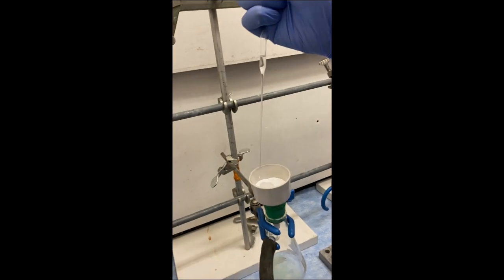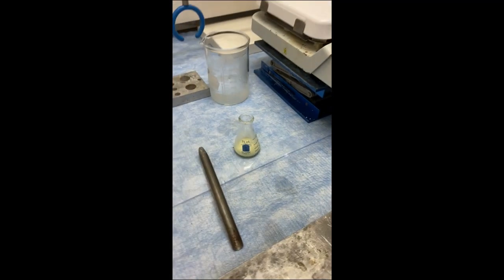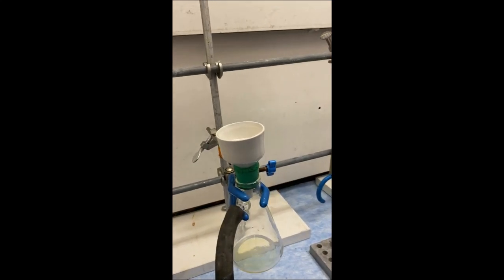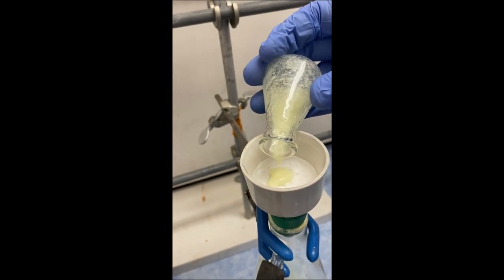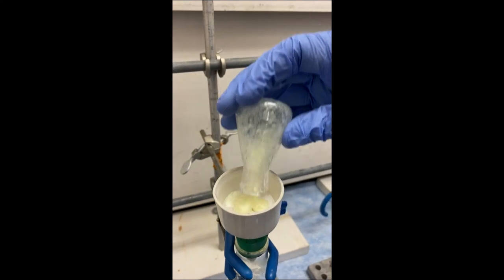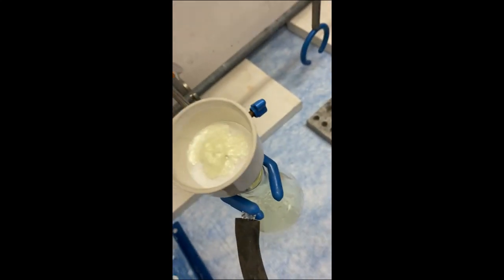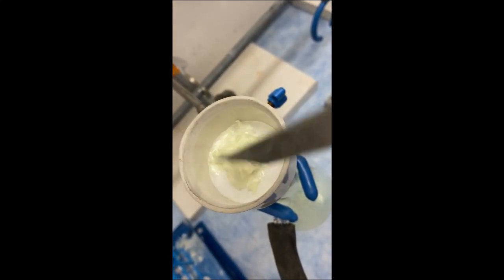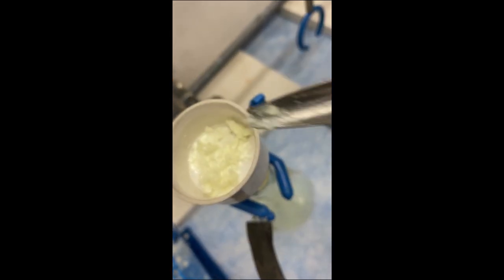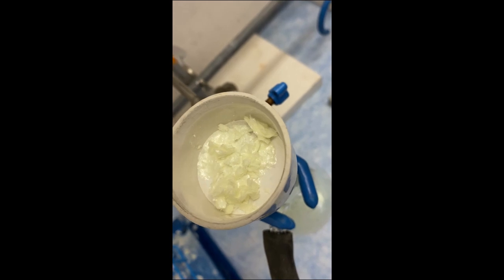Roberto is going to wet the filter paper. You can see how the product crashed out quite nicely, and you can actually see how the crystals are now this beautiful light yellow color, which is the color of our chalcone. We're going to leave this on here about 15 minutes to help get all the crystals and drive the ethanol out. Anytime we use a solvent that can hydrogen bond and our final product has a carbonyl oxygen that can be a hydrogen bond acceptor, we need to be very careful and make sure we get this nice and dry — otherwise our solvent's going to show up all over our NMRs.